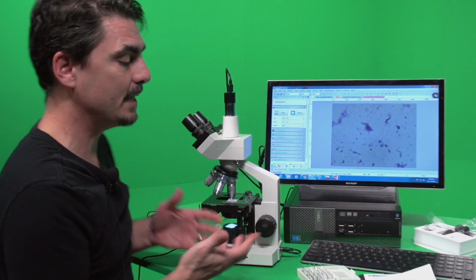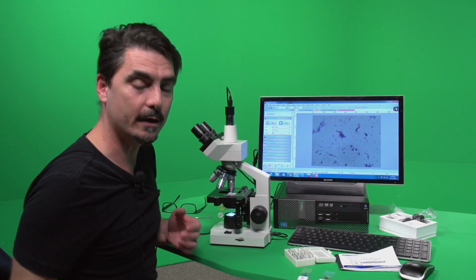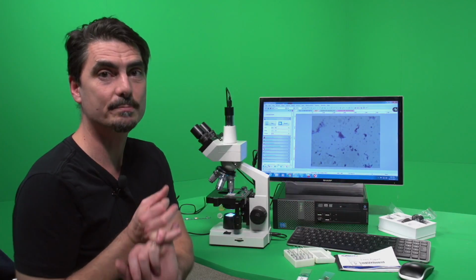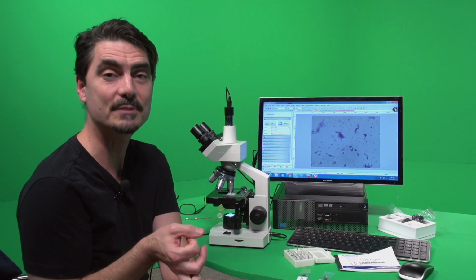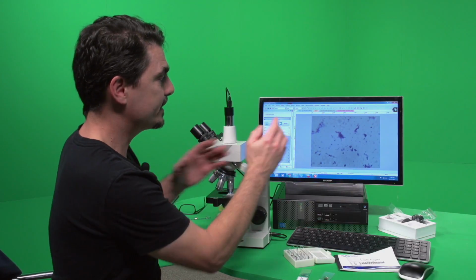And that's one of the things where sometimes the prepared slides aren't perfect. The slides that you prepare from the E. coli and the Staphylococcus epidermidis, that should be very coccus, right? Hence the name Staphylococcus. So that should become a lot clearer. But anyway, this is what we've got.